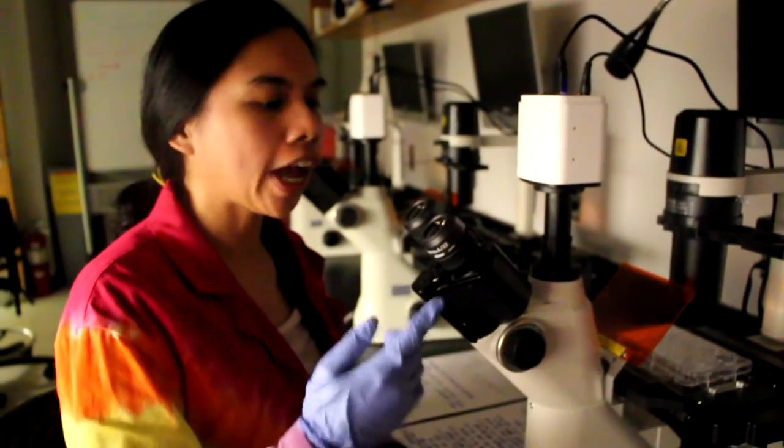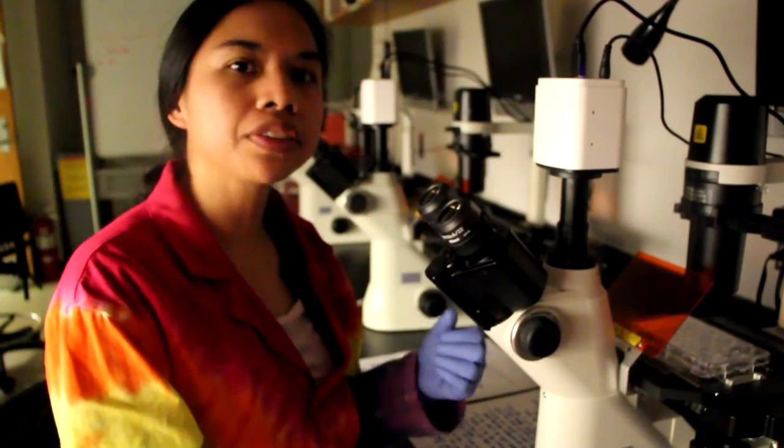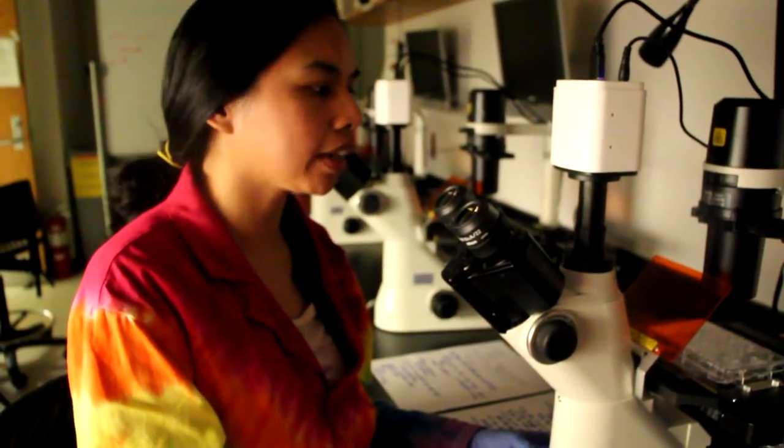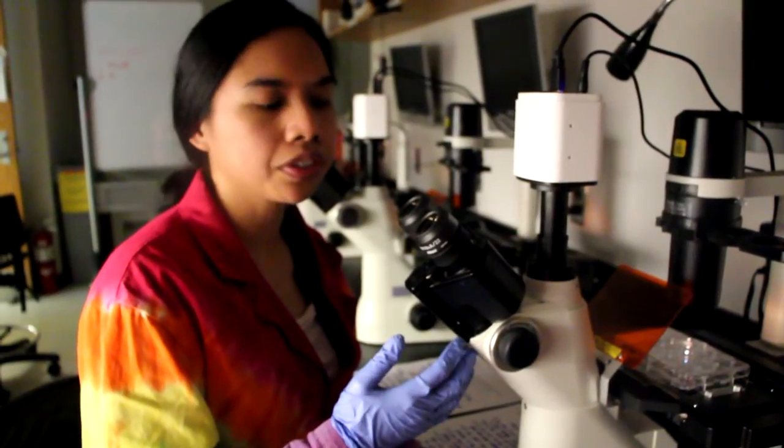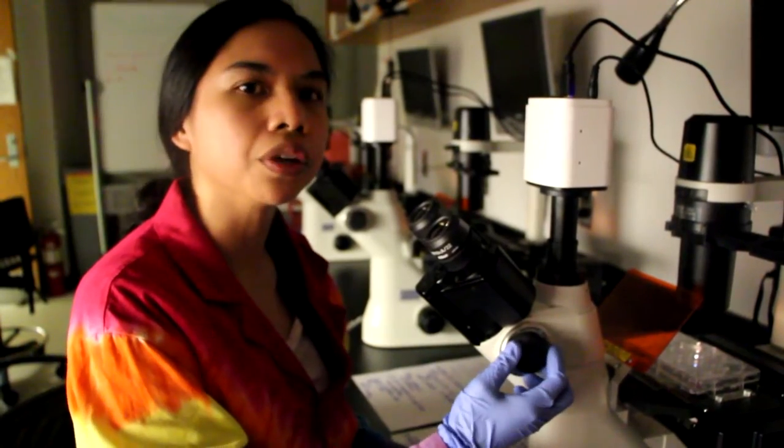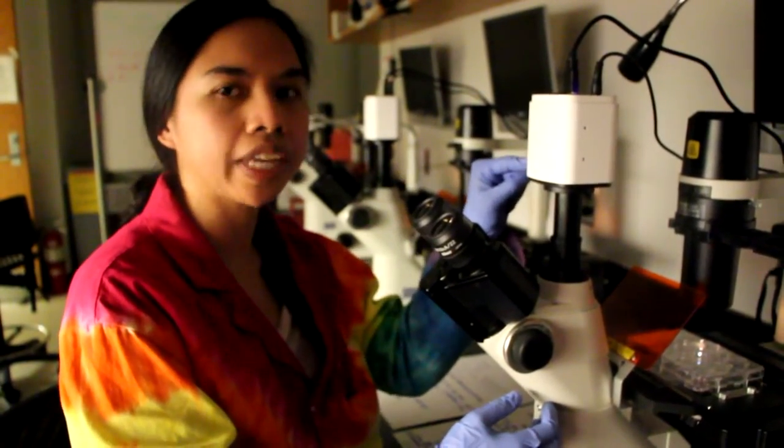If you look through the eyepiece and you can't see any light actually coming through, one of the things that you might want to try doing is changing the dimmer switch or increasing the intensity of the white light that's coming through. You should be able to see the light passing through the sample on the stage. The other thing to try is to make sure that the knob over here is set to bino, which means that the light is coming through to the eyepiece, as opposed to going to the camera.